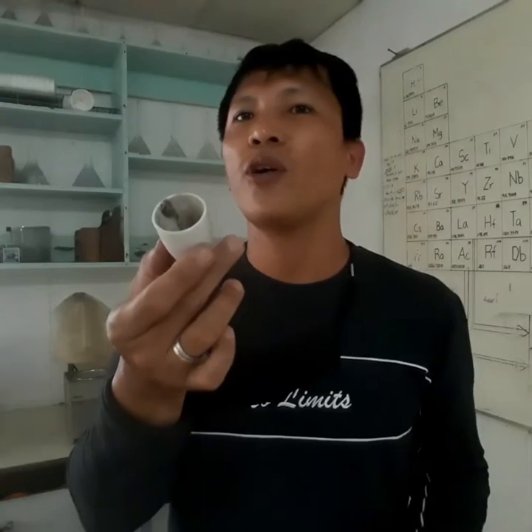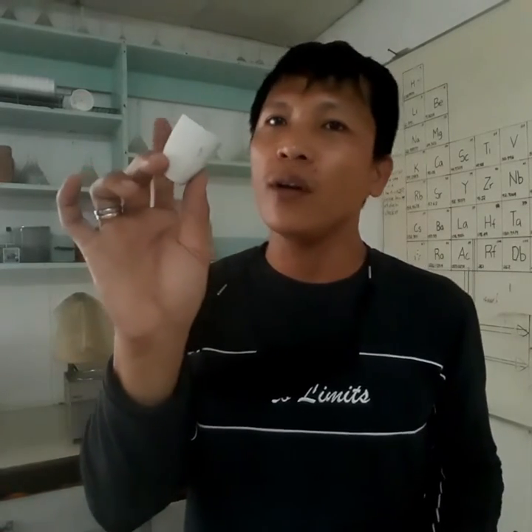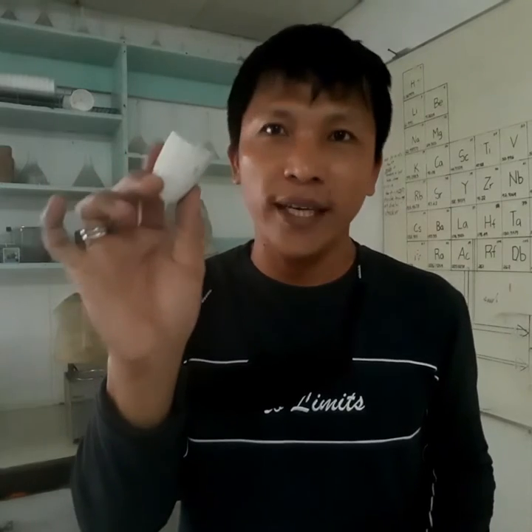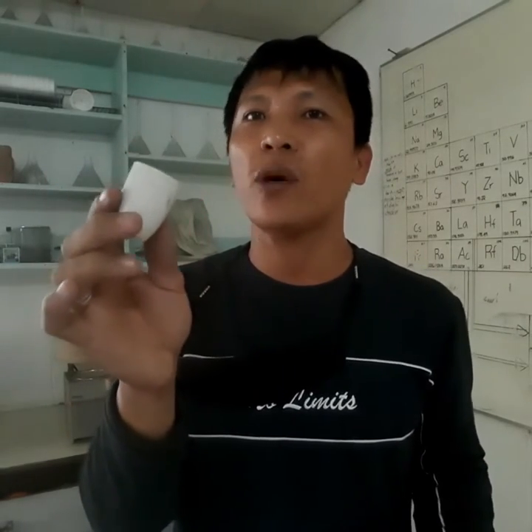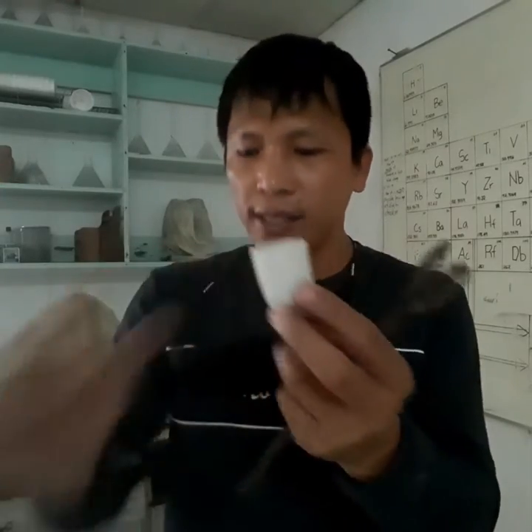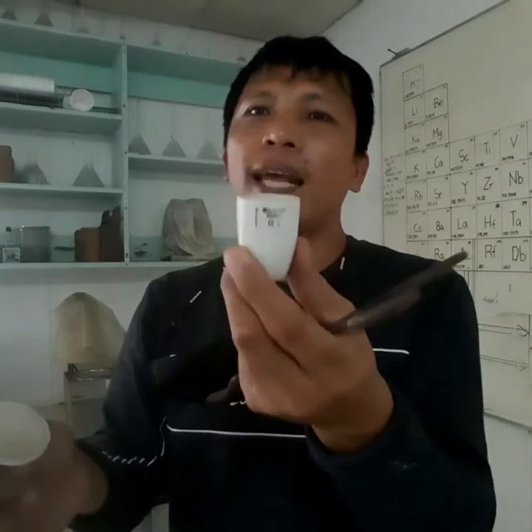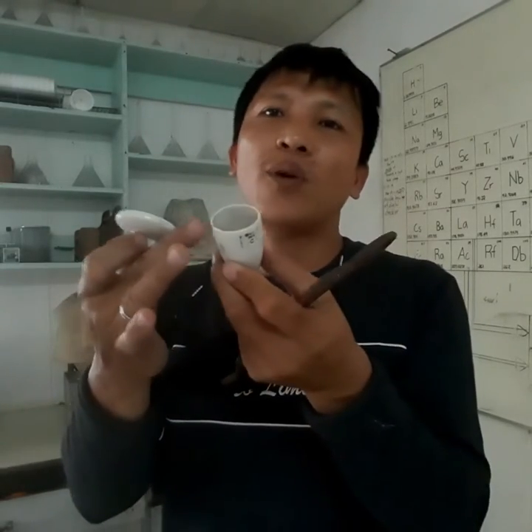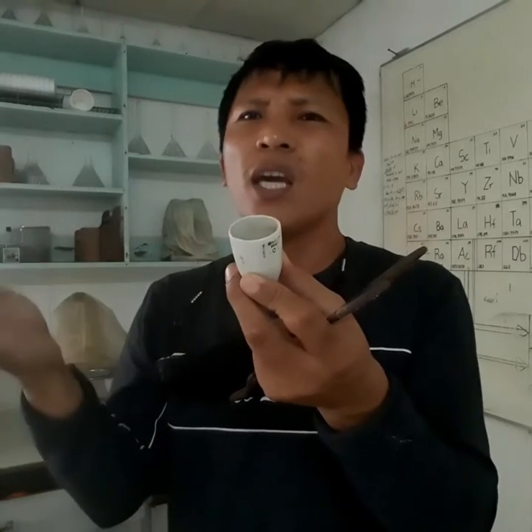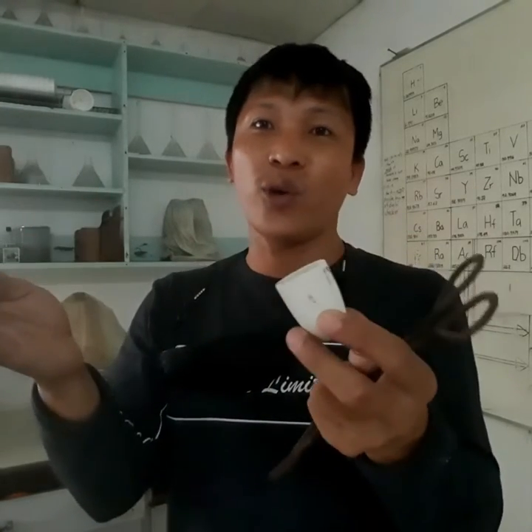You can perform gravimetric analysis wherein you put this crucible into an oven, or drying processes wherein you apply heat and just remove the cover. So basically, a porcelain crucible is used for any small sample that you're going to dry, heat, or react, of course.